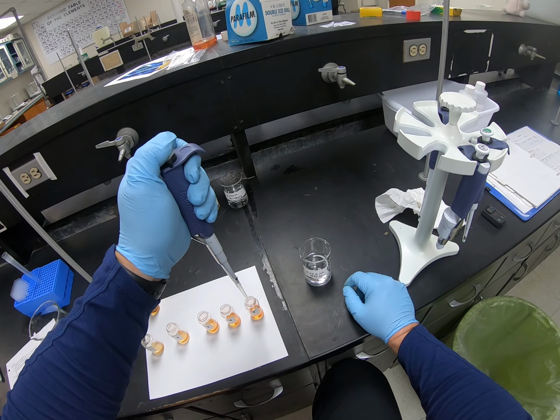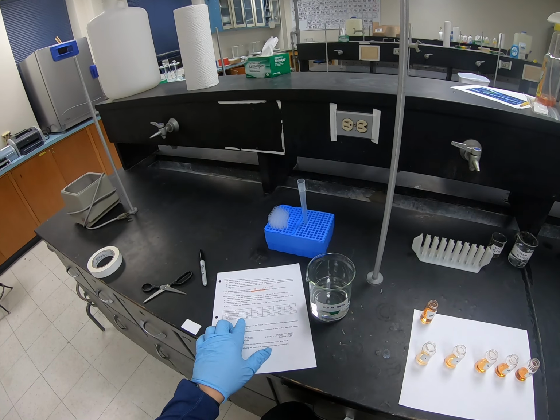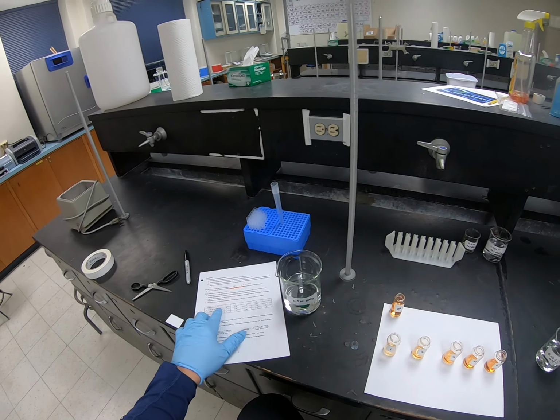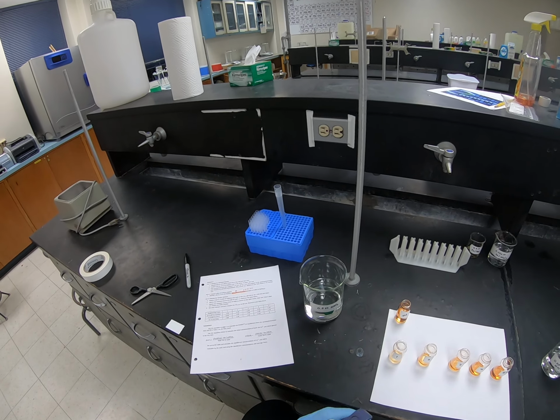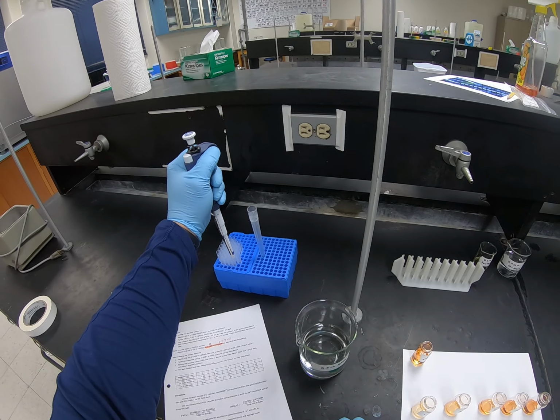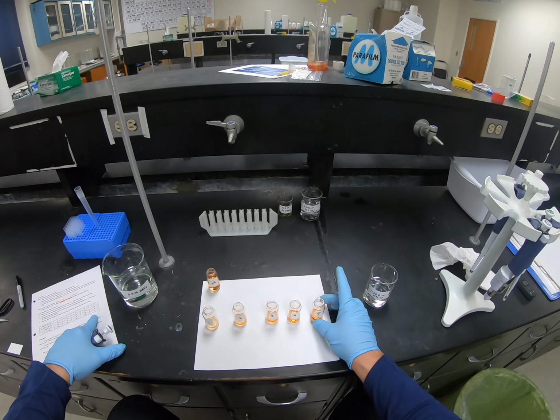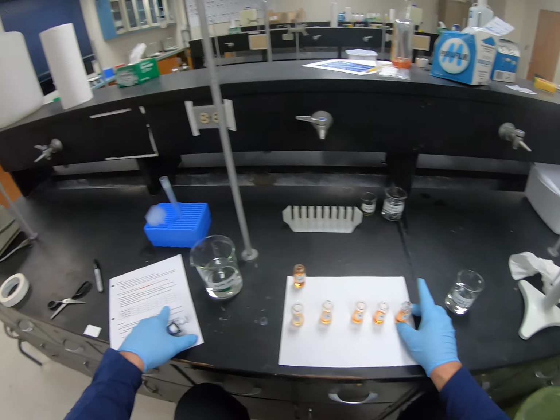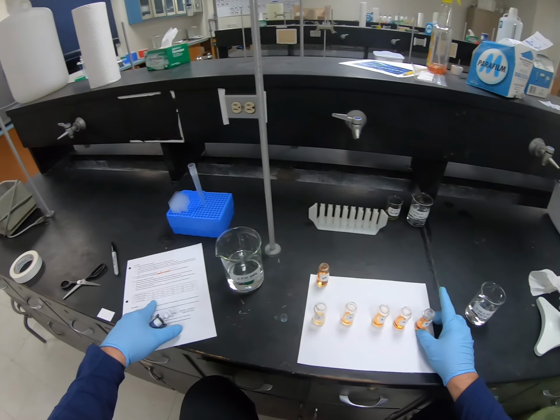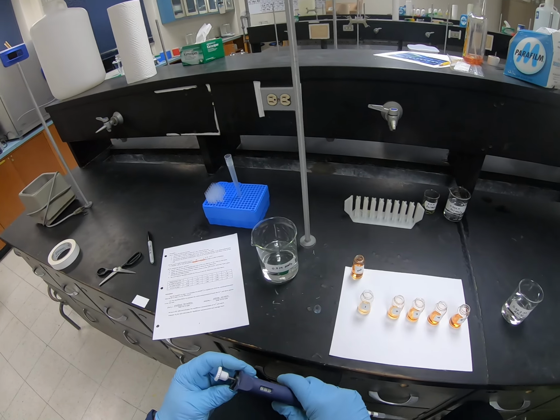All right, so the last thing I need to do is add the last reagent. The last reagent is the 0.5 molar nitric acid, and I need to vary from 1/2 ml. Actually, number 5 is used as it is. Okay, but in number 4, I'm going to look at, I guess I'll start at 1 and work my way up. So let's look at number 1. I need just 2 mils.